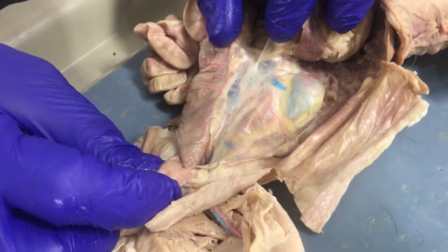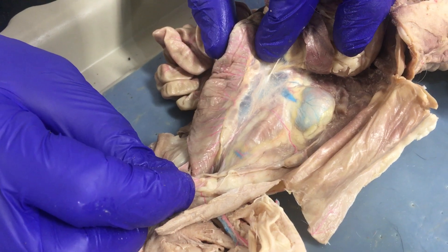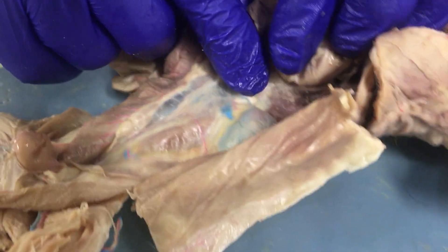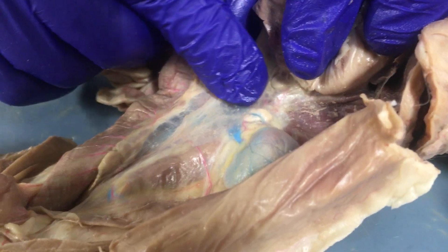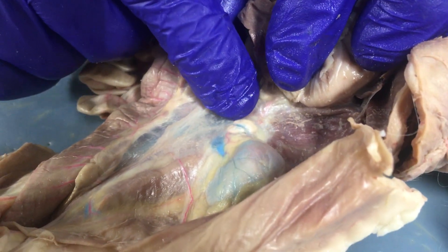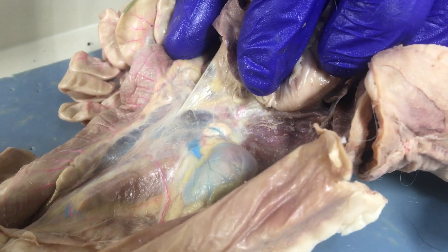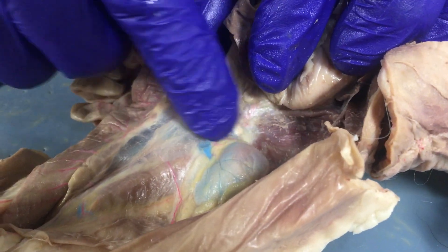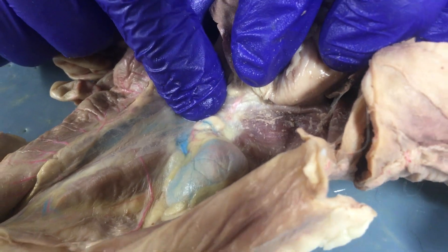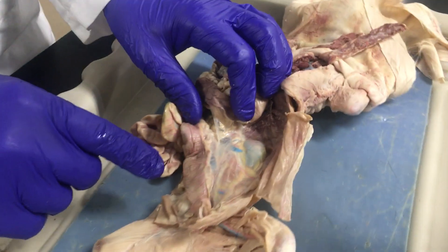We will find the ureters later. The adrenal gland is here in the cat — you can see it with a little blue vein crossing it. If you look closely, you'll see the pebbly appearance of a gland. So this is where the cat's adrenal gland is.